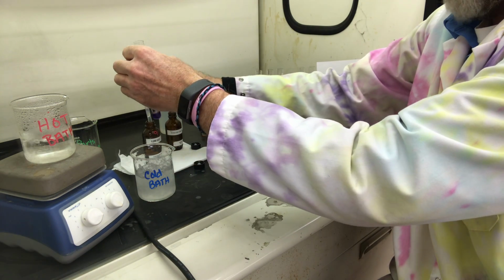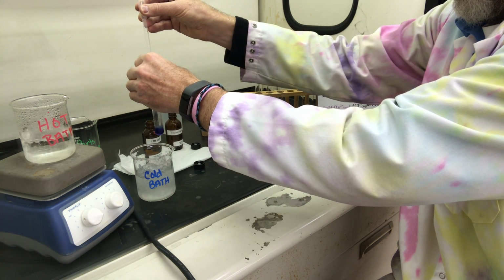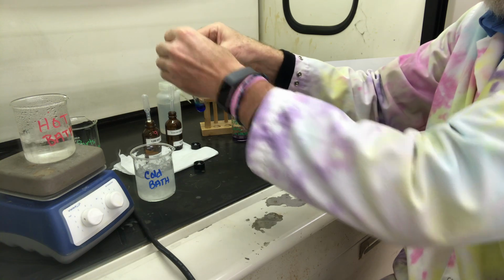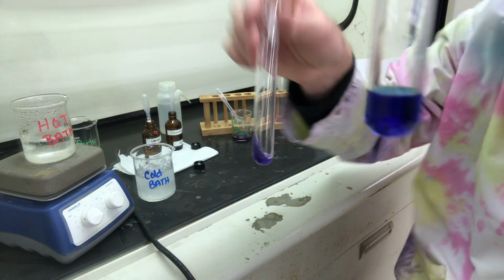And we're going to add 5 drops. Here it is. Let me show you our control.